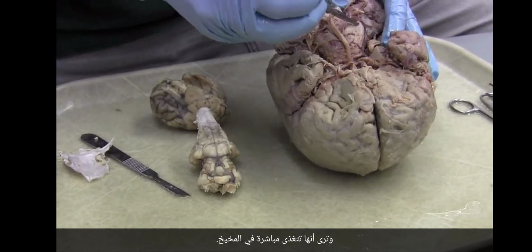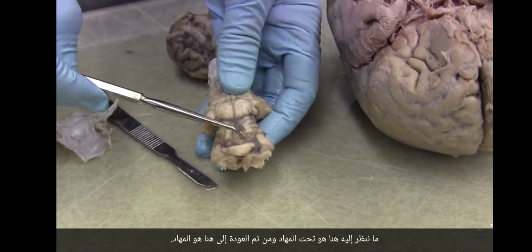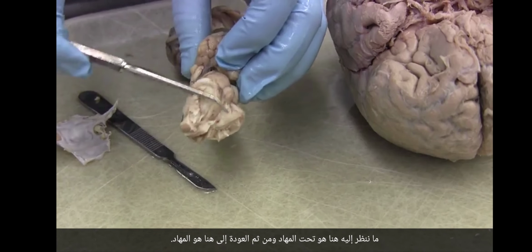So in front of pons is midbrain. Here's the midbrain. These are the oculomotor nerves that control voluntary movement of the eyelid, plus a lot of eye movements, including all the vertical eye movements. And then in front of that is diencephalon. What we're looking at here is hypothalamus, and then back up here is thalamus.